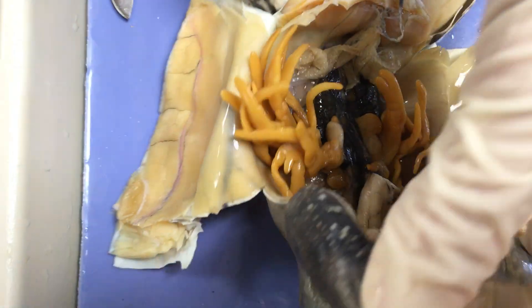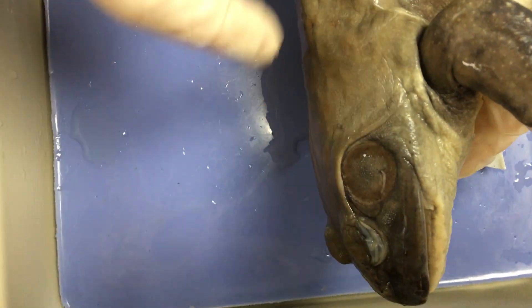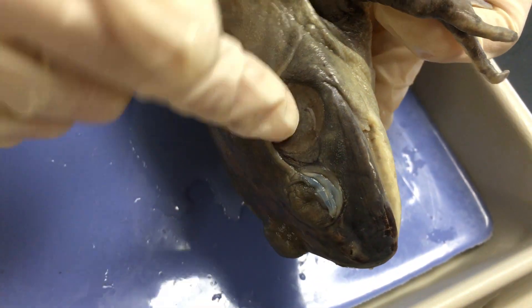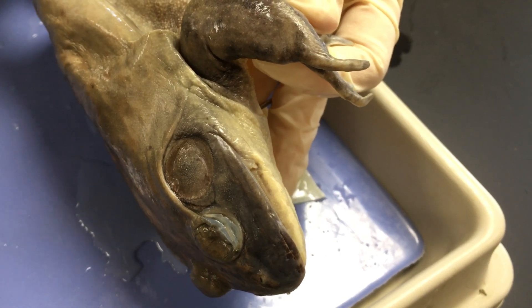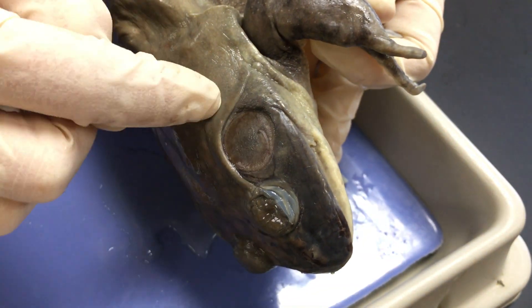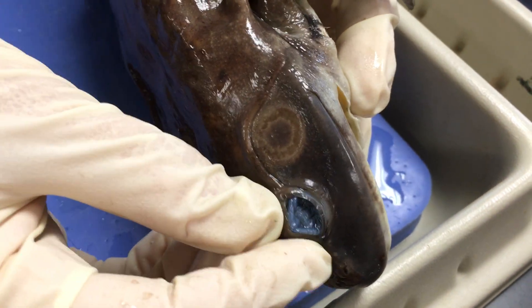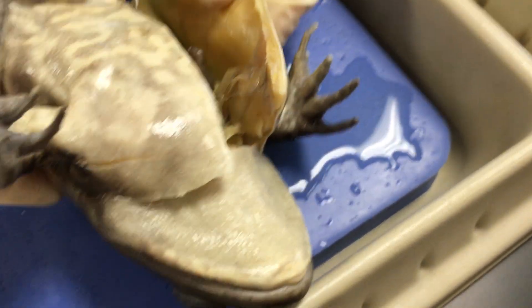Let's look at the outside of them real quick. When we talked about external anatomy, we discussed looking at the tympanic membrane to externally distinguish the male and female frog. The easiest way is to compare the size of the tympanic membrane to the eye. A tympanic membrane larger than the eye, with a big thumb, and maybe vocal sacs, is going to be a male. Based on the size of this tympanic membrane, this is likely a male, versus this frog over here whose tympanic membrane and eye are much more similar in size, making it likely a female.